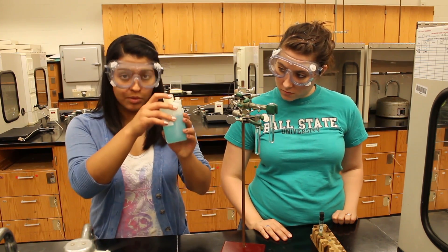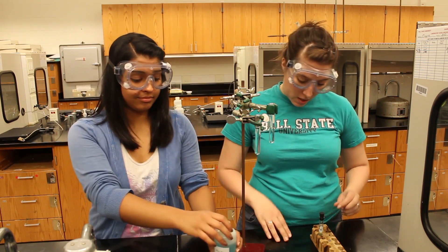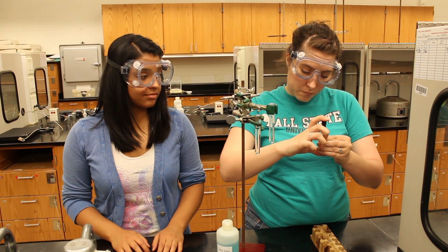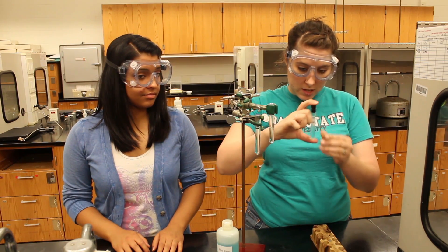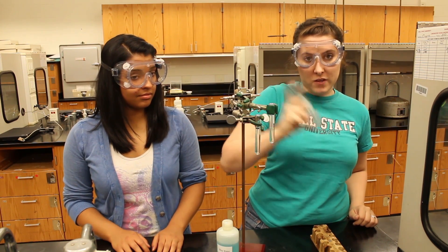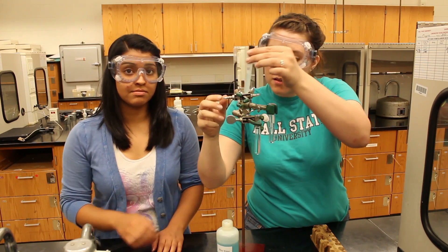In order to tell if a compound is soluble in water, the water has been given a blue color. When you're mixing the samples with water, make sure you put the rubber stopper in tight and shake vigorously. Remember to wash the rubber stopper so that you do not contaminate the rest of your solutions.